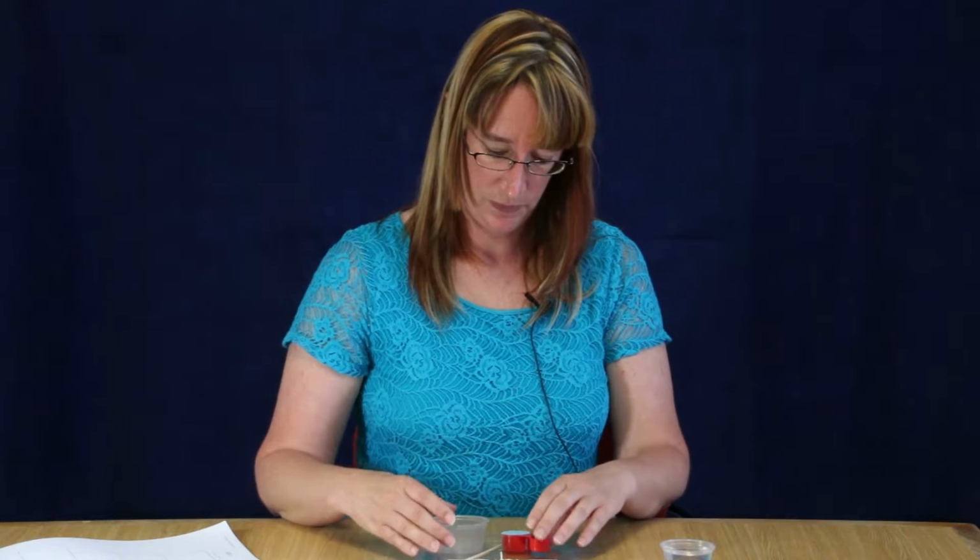You're going to start by demonstrating the process using copper sulfate. You're the only one who will be doing the copper sulfate. The students won't be doing that. They will be using other materials. So you're going to do this, and everything will be labeled for the students ahead of time with the different materials that they're using. We're demonstrating just with the copper sulfate right now.